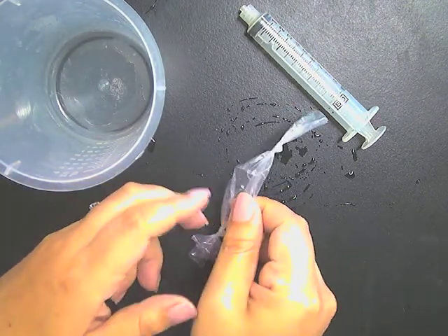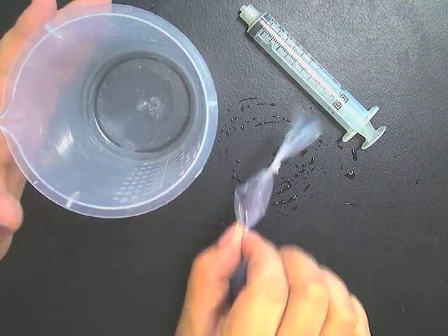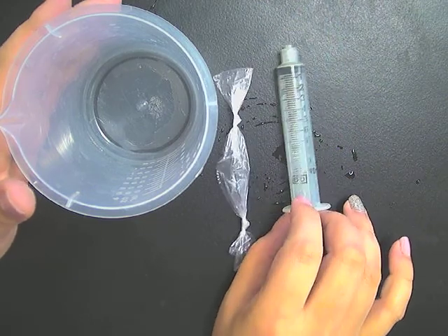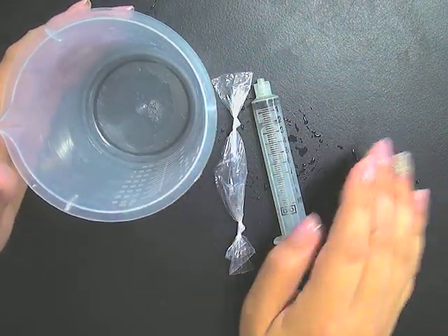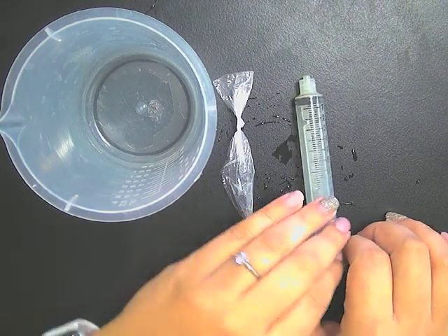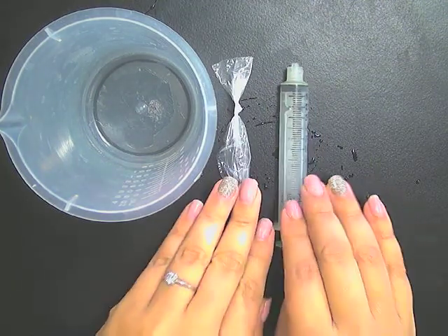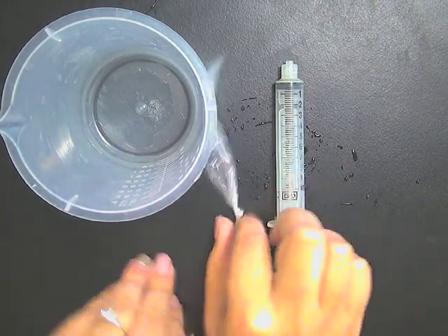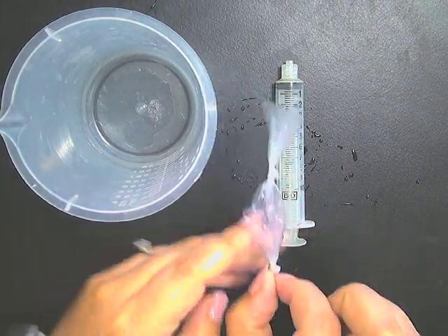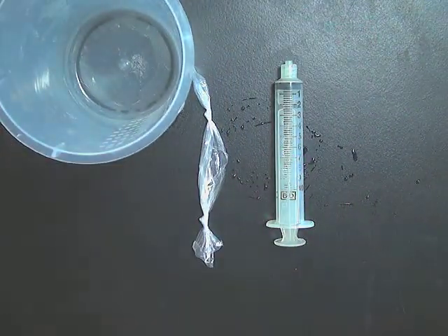Okay, so when you come into class, I will have beakers with dialysis tubing. I'll have syringes for you to use. I'll also have your different colored solutions. And then I'm also going to assign you a specific color that you are going to test. So you're only going to test one color, recording the initial mass, submerging it, allowing it to soak, and then recording the final mass.